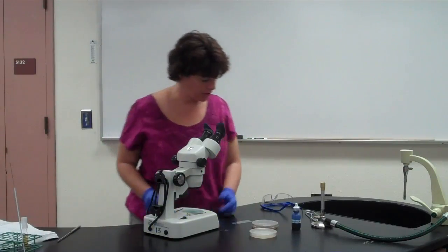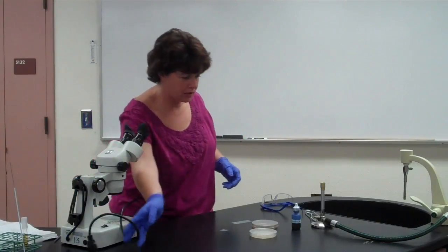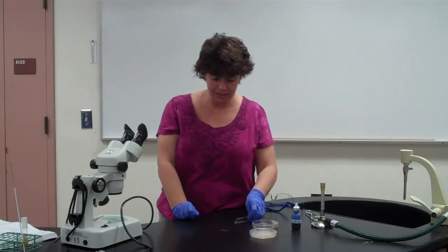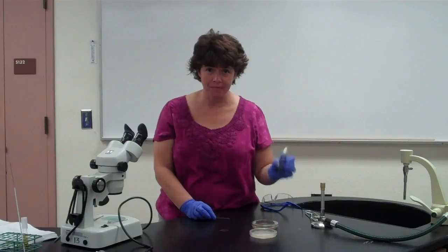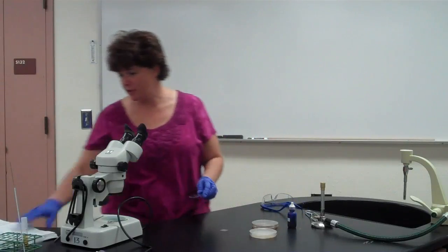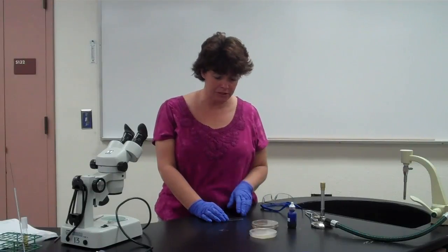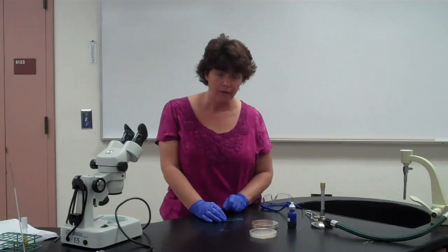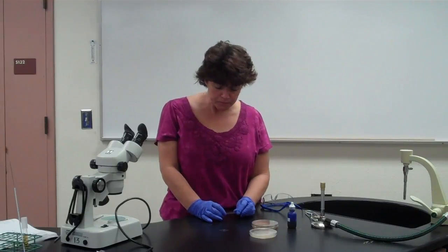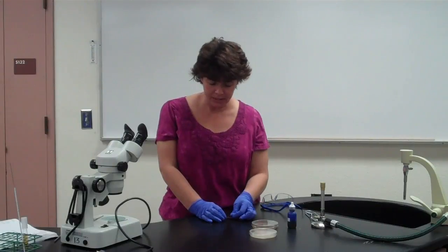Also during the second period, you're going to be making a wet mount of your slide. Now, I don't think I need to go through this procedure again. We did this last time. You're going to use that lactophenol cotton blue solution, and you're going to put a drop of it on there, and then you're going to take a loop full of your colony from the plate that you had grown, and you're going to put it on there. And then you're going to put the cover slip on just like you did last time.